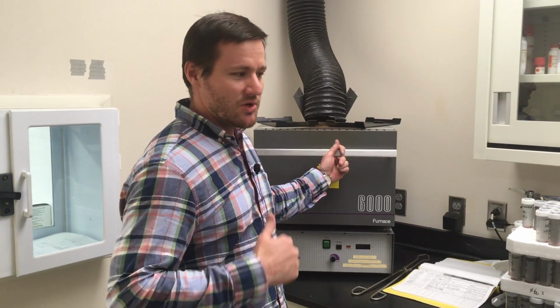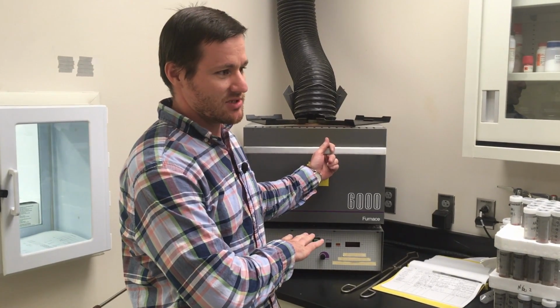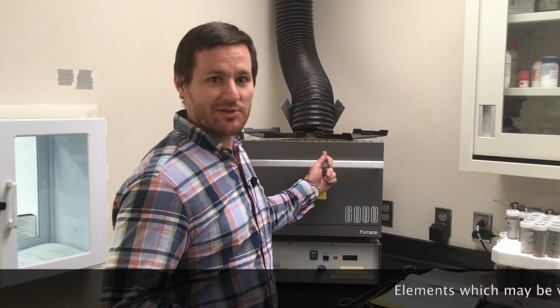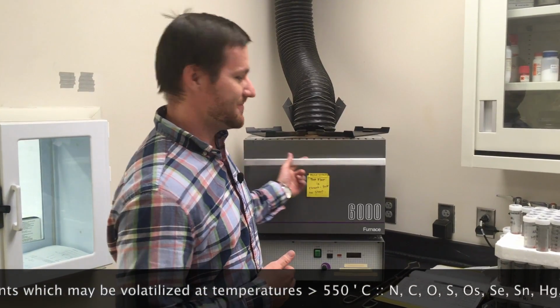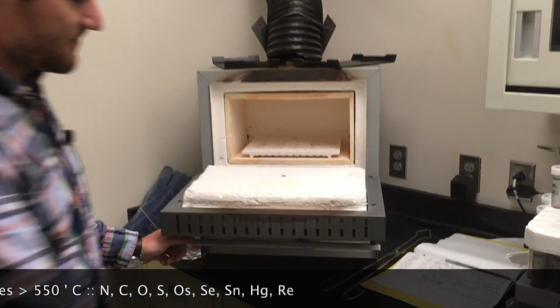One of the reasons you might not want to use this is perhaps you do want to get rid of organic material, but you don't want to volatilize some of the elements that you're interested in. This would be a bad approach, but for typical things we do in the lab, sometimes this works pretty well. So this is our asher. This is the inside of the asher.